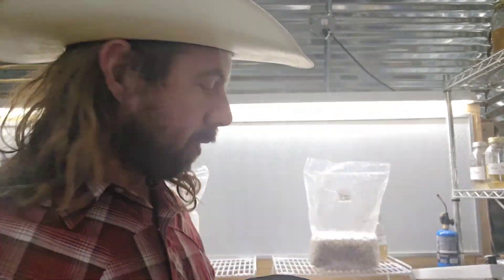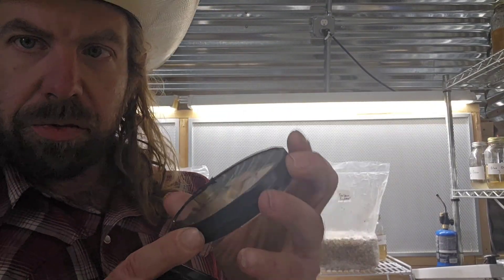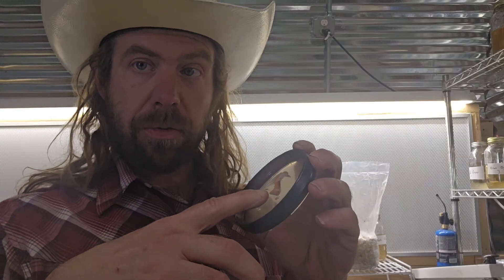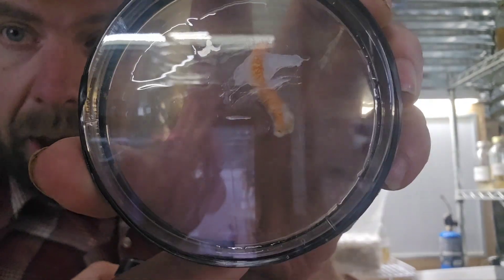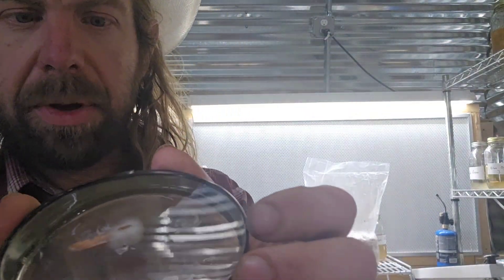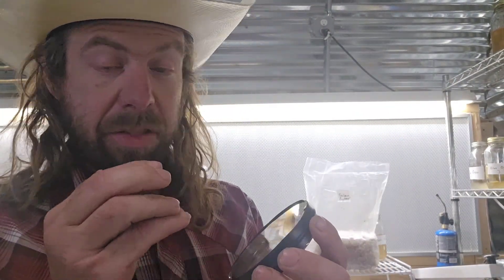Here's how the multi asco spore collection turned out — check out some of these plates. This one is growing quite a bit; here's another one going really hard; here's another good one. I made a lot of these. Now, I attached the fruit body to the top of the petri dish with petroleum jelly. You can actually see little hyphae growing out of the fruit body — spores germinating right on it, showing white fuzz mycelium. Look right at the tip there — that's mycelium. Yesterday the hyphae were even smaller and blasting out more; now they're starting to fuse together.